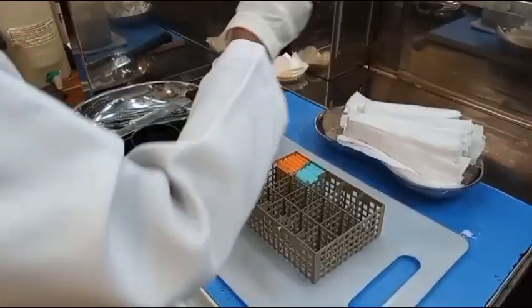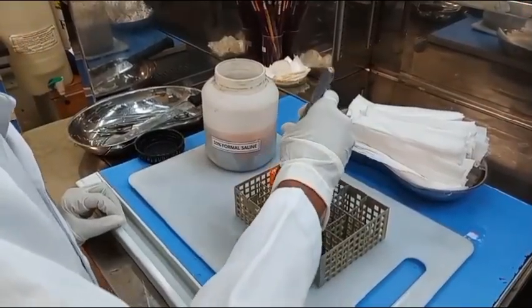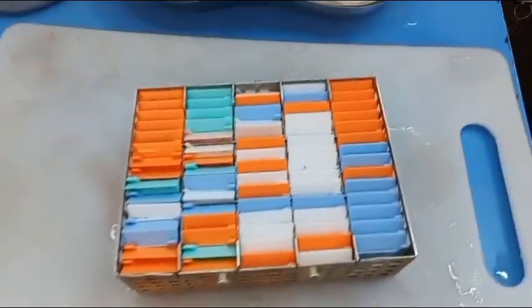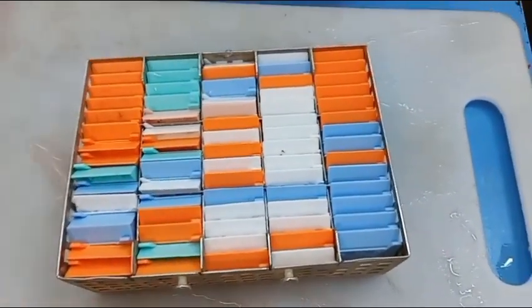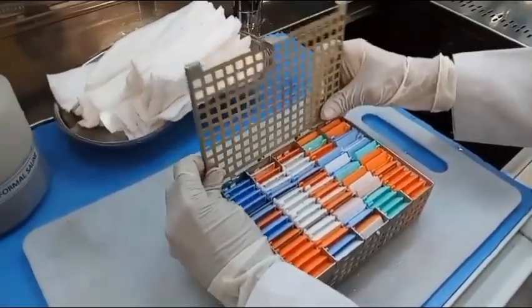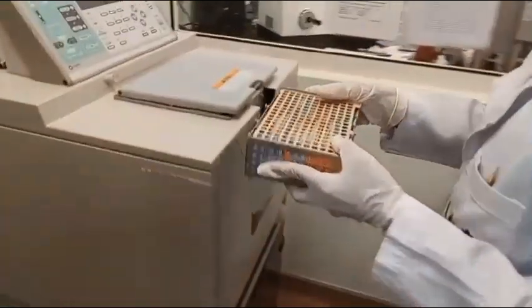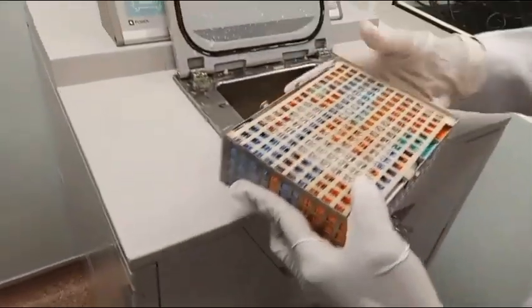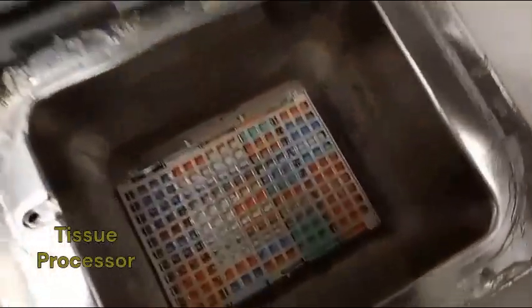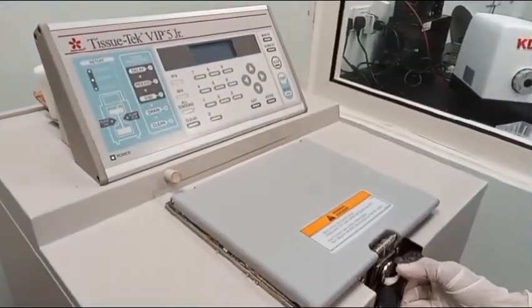Tissue processing. Tissue processing is the procedure which prepares fixed tissues into a form suitable for embedding within a supportive medium such as paraffin. This is an automated enclosed tissue processor. The specimen cassettes are put into a process chamber or retort, and the reagents are pumped in and out as required. Closed system tissue processors prevent tissues from drying out in the event of a power failure and prevent chemical fumes being released inside the laboratory. Therefore, they enable the processing of samples in a safe and reliable manner.